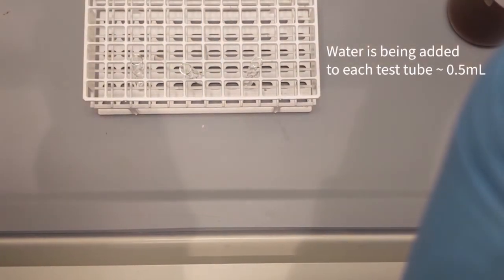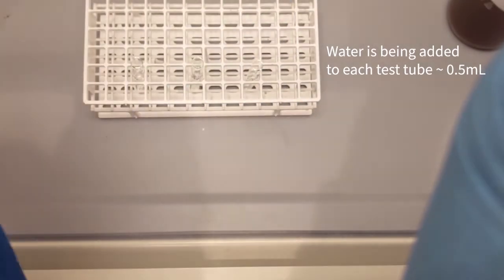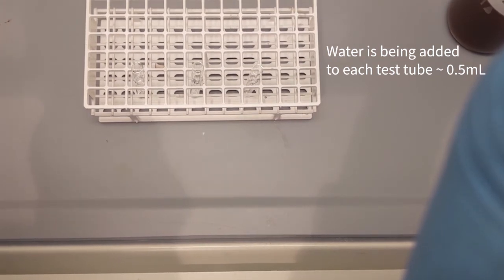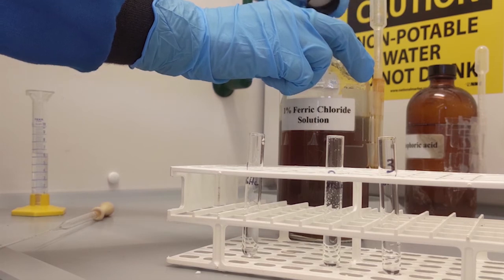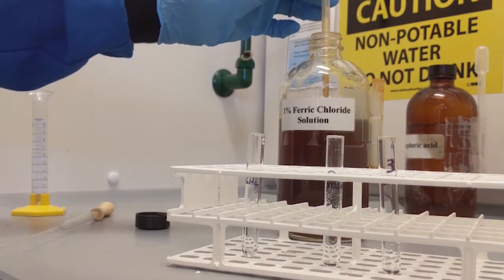Since ferric chloride test gives a positive result in the presence of phenols, it would give a positive result in the presence of salicylic acid. If your product does not give any color, it means that you do not have any starting material in your product, which means you have synthesized aspirin by using all of your starting material.